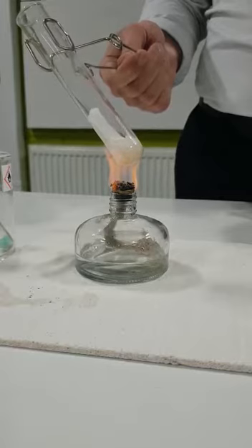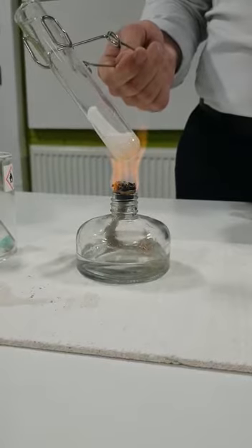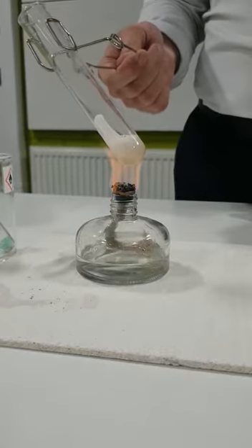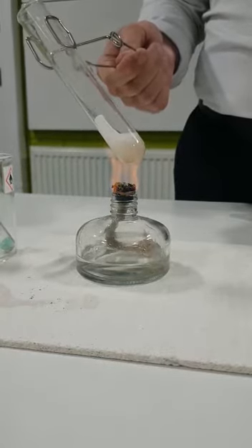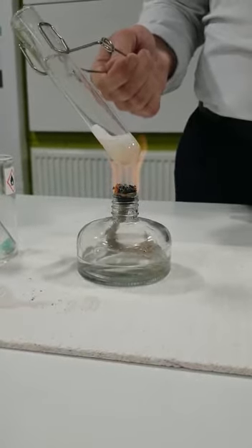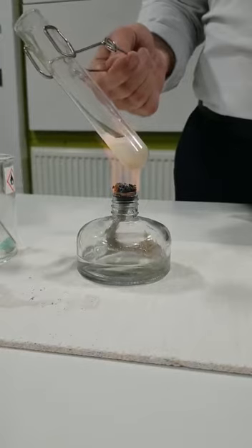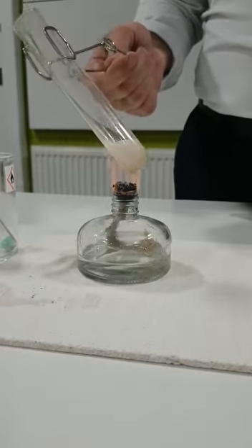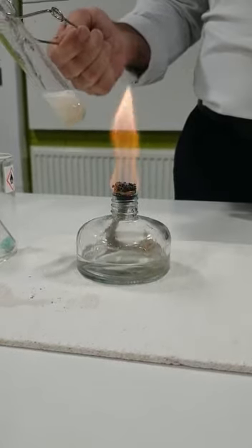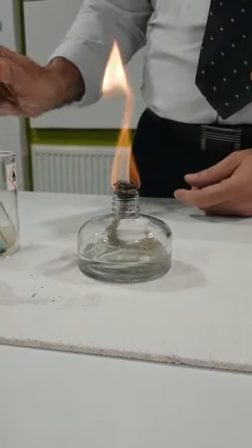All of you know what will happen, but the important thing is to explain, is it physical or is it chemical? And you need to explain why. See carefully what your observation is, what you observe, what is happening. You need to draw a schematic diagram of the equipment and arrangements, and also explain what is happening and your conclusion, why it is a chemical or physical change. Okay, so this is the first one, about melting ice.